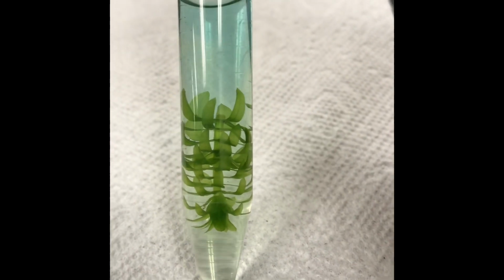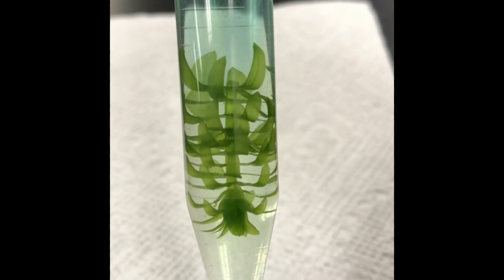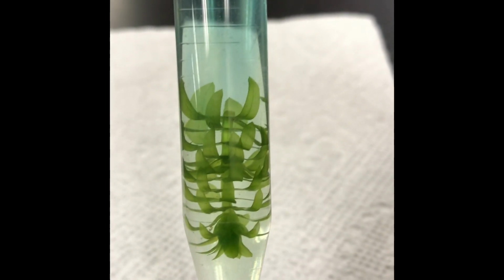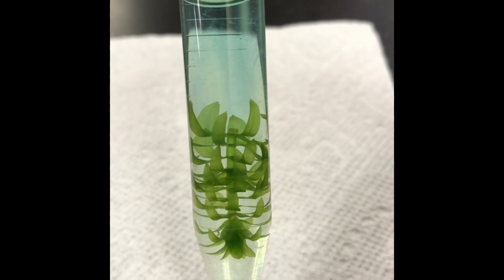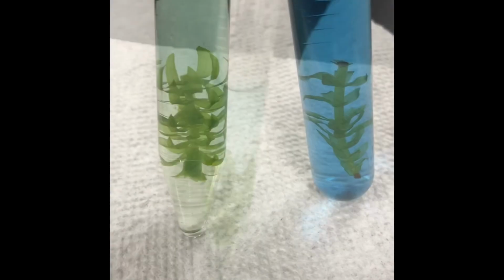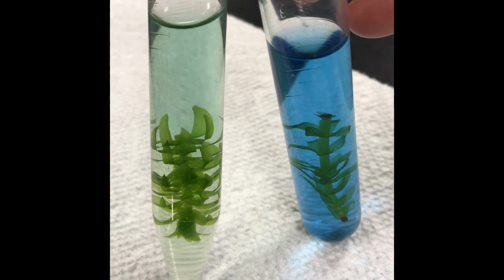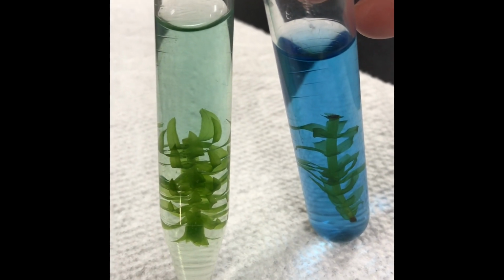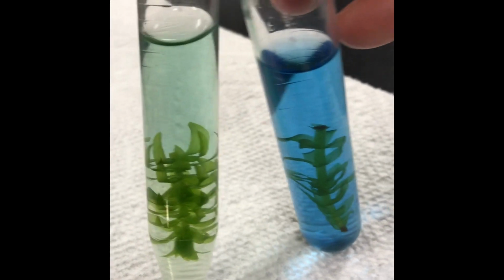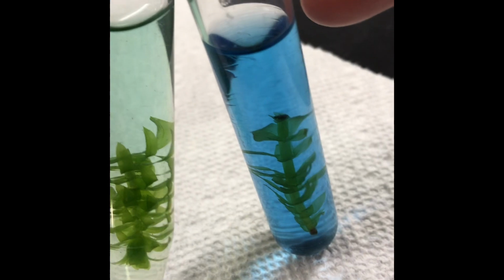Okay, here's the tube from the dark cabinet. Now really look at the bottom, because that's where most of what's happening is occurring. Okay, so this one, remember, had the bromothymol blue in it, and it was like dark blue from the beginning. Look what's happening now. You can see there at the bottom. But to show you a real comparison, I'm going to show you this tube from the dark compared to the one that was in the light. There you go. Look at that comparison, guys. So the one that you see on the left, that's got that tint of like a light yellowish green, that's the plant that was in the dark cabinet, not exposed to light. And the one on the right was exposed to light.